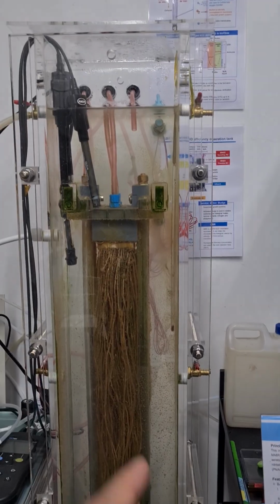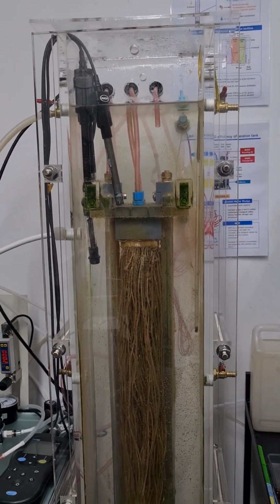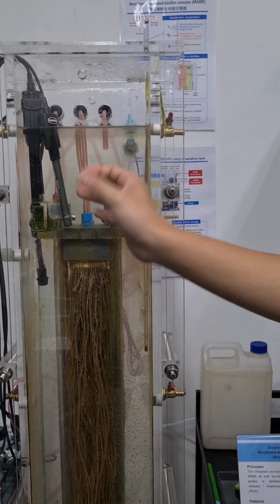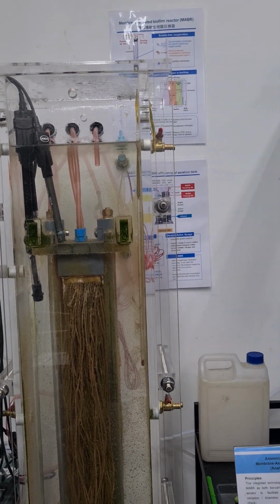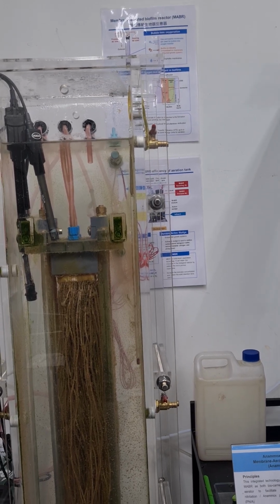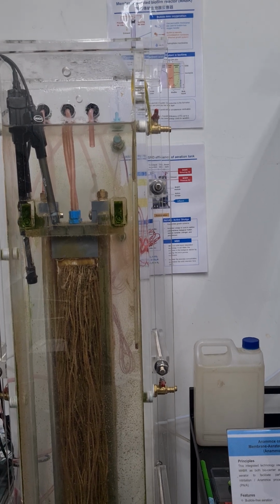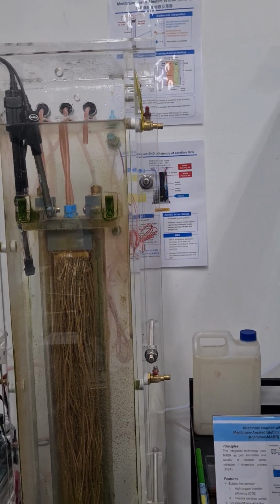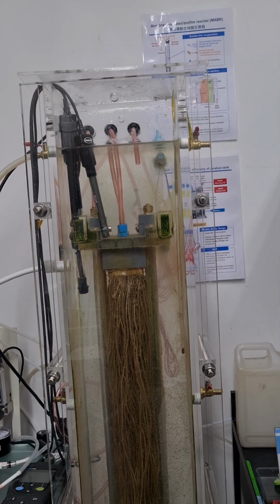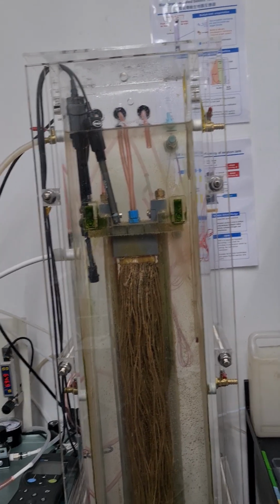I see. So these bacteria are from the activated sludge inoculated? Actually, it was inoculated with pure Anammox bacteria, but most of the sludge is from wastewater sludge, with also a little portion of pure Anammox. Okay, pure Anammox. So where did you get pure Anammox? Since we have a cooperation with another lab, they are experts in this.